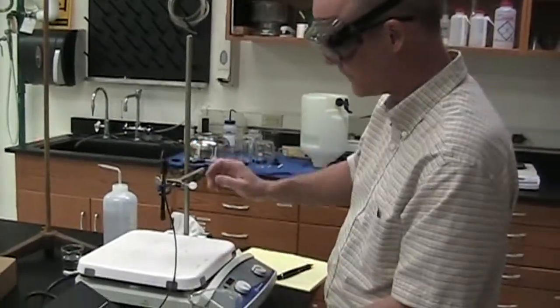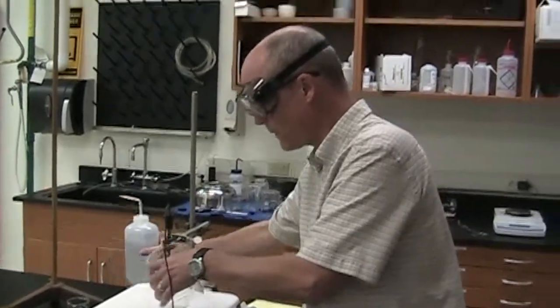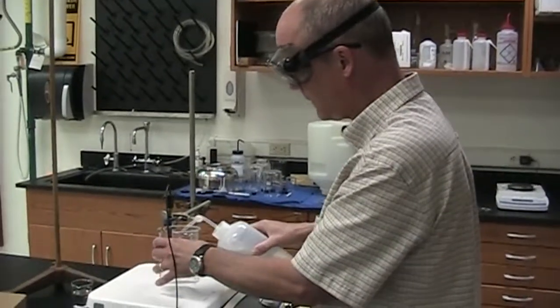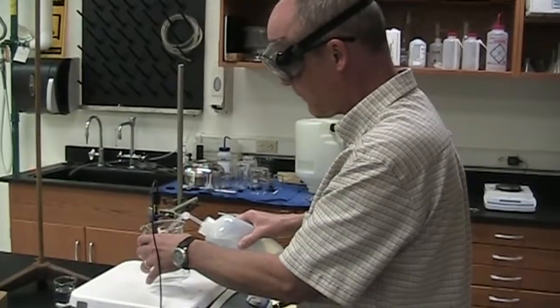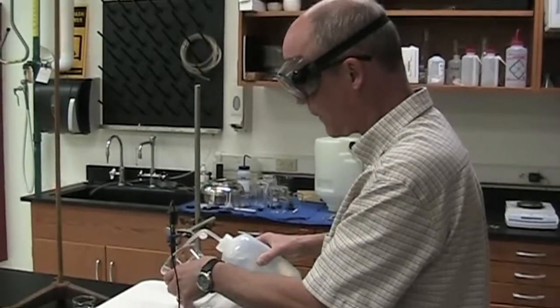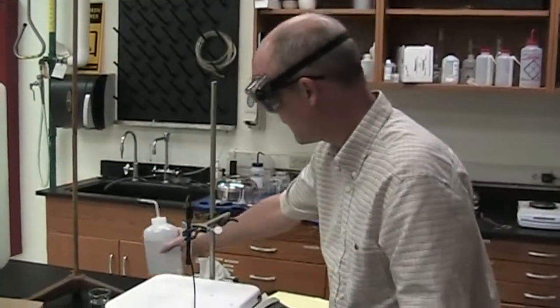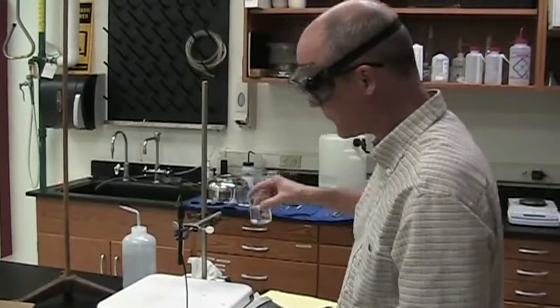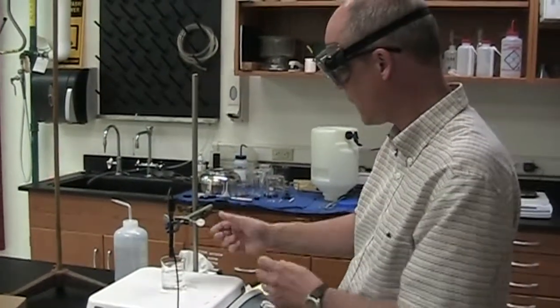Here's your last sample. I'm just going to do the process essentially one more time. Again, rinsing the electrode. In this case, I'm probably not even concerned about dabbing it off or drying it. And then simply immerse the electrode in the solution that was there when you got there.